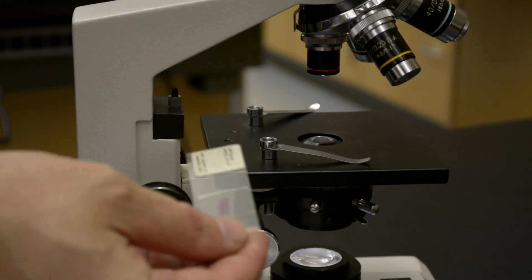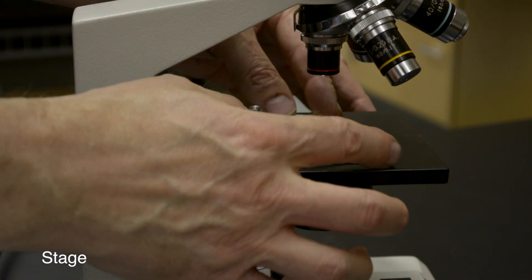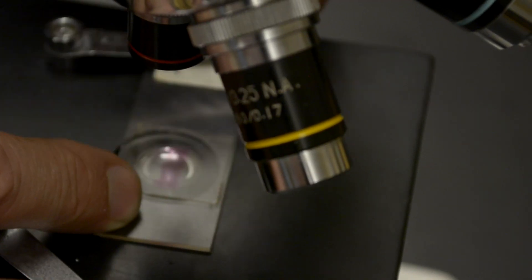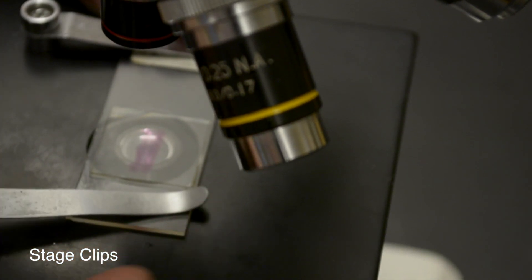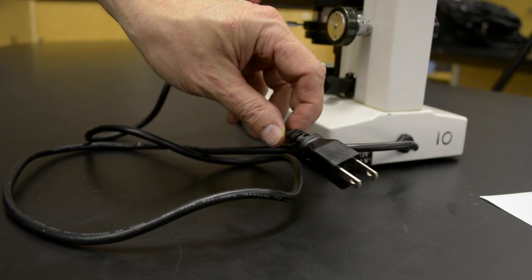The slide you are looking at on the microscope is held on what is called the stage. It is held in place on the stage with a pair of stage clips. These stage clips hold the slide steady while you look through it.